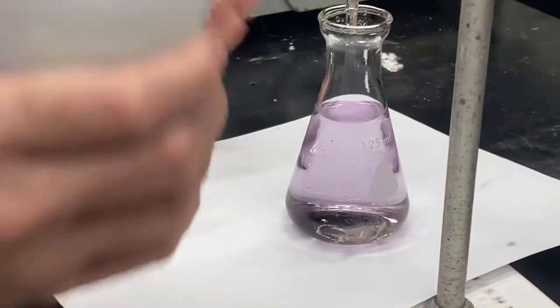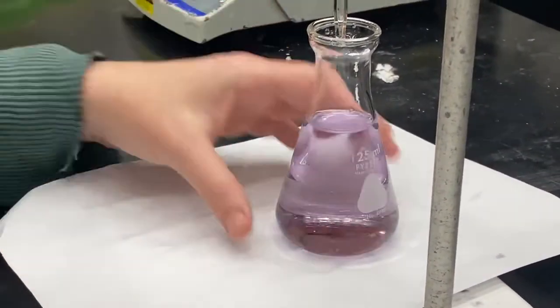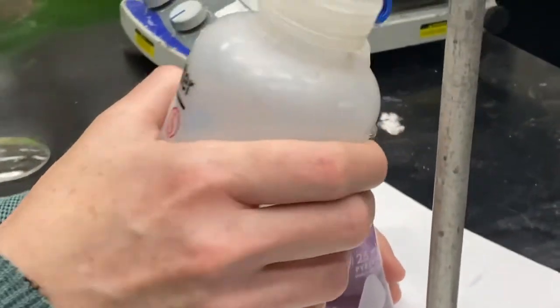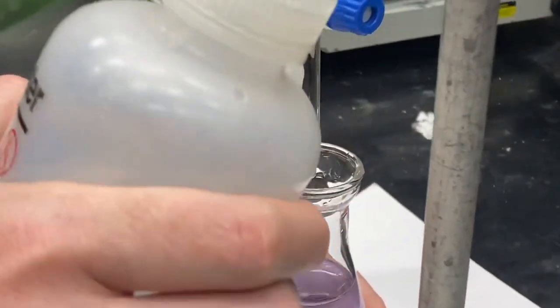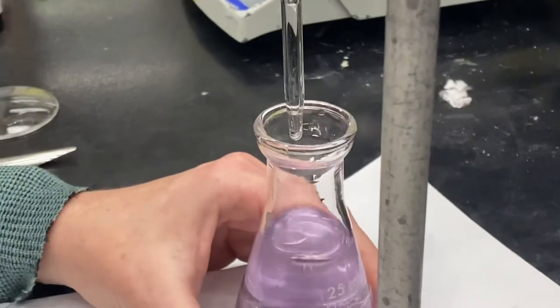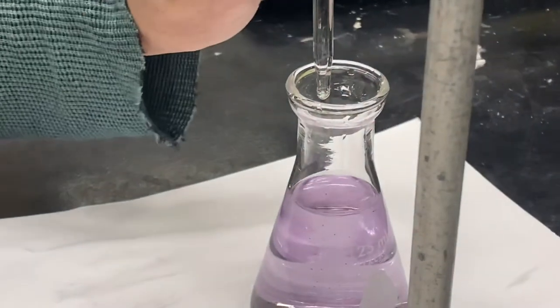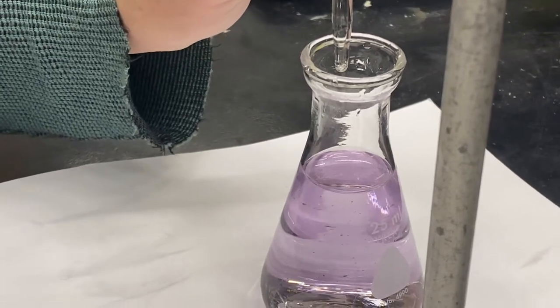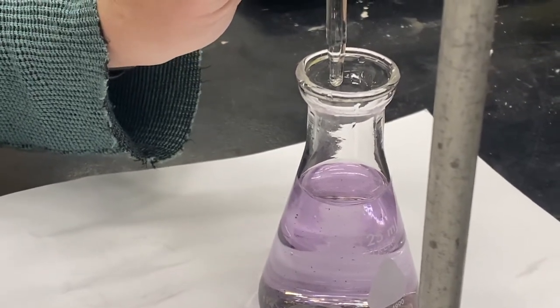So you want to take your time and get these little, what we call half drops, or I like to call them little clingers. And you also want to make sure that you don't have anything on the sides of your flask. So go ahead and use some water to get that down. Obviously water will not affect the number of moles of the stuff you're interested in. That's why it's okay to add water, which is a common misconception.